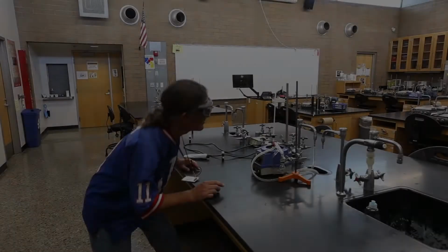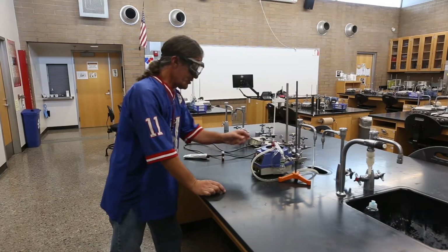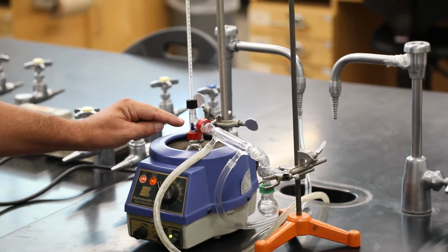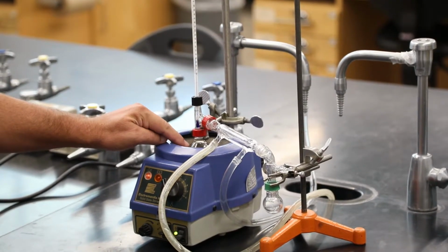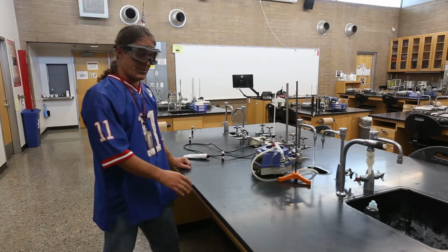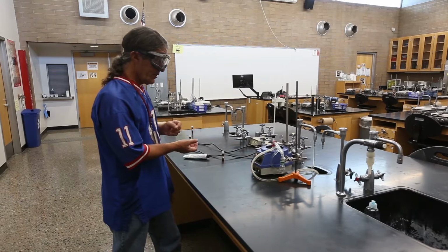Alright, it looks like our liquid is boiling, which is nice. And the temperature has grown up to about 30, which just means this whole apparatus is warming up. We're probably going to see it really shoot up once the boiling liquid starts to condense on the thermometer. Then it'll go up quite substantially. And this is where a lot of times people want to record the temperatures.